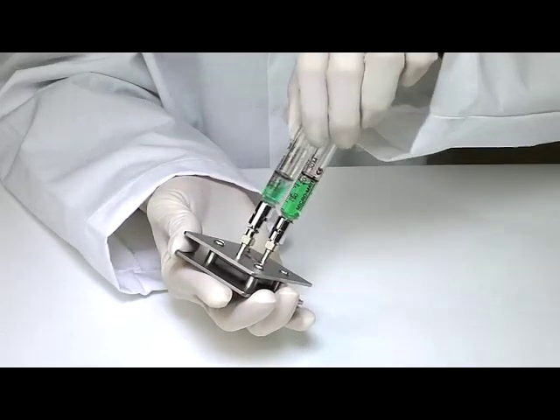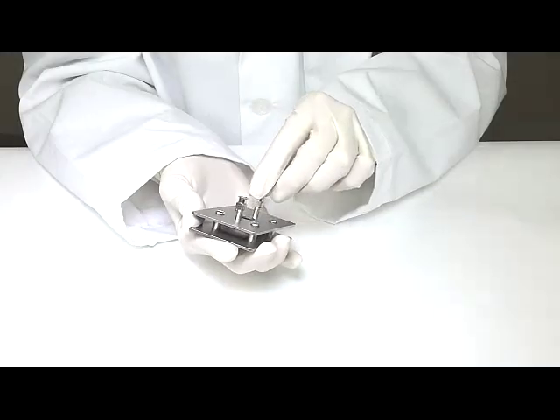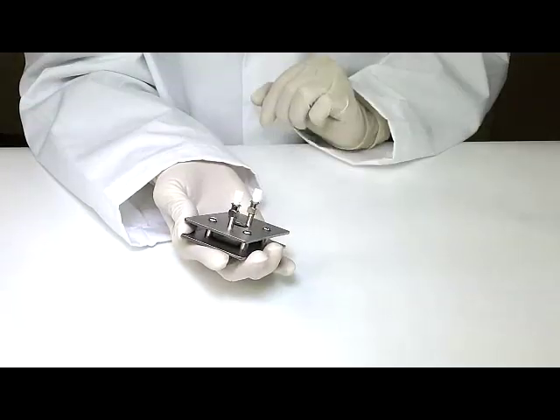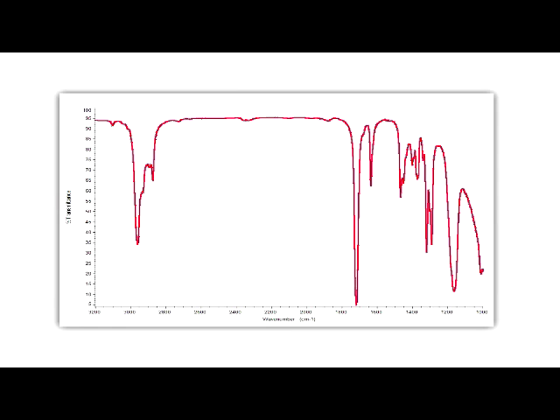Once filling is complete, remove the syringes and replace with stoppers. You're now ready to collect an infrared spectrum on your sample.